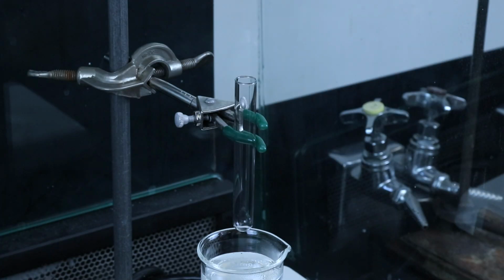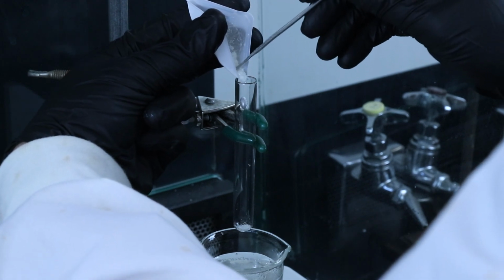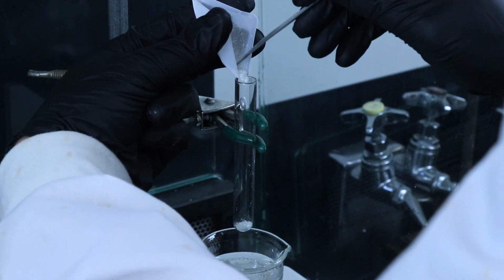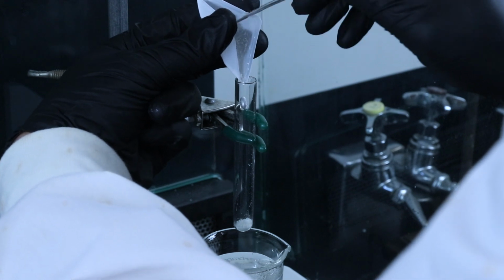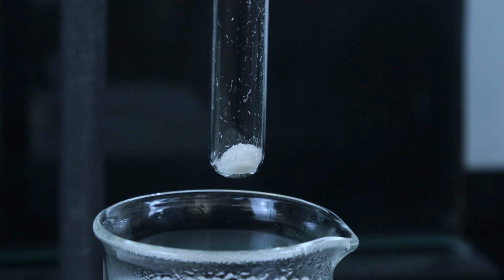So you'll want to transfer your crude product over to either a test tube or a Craig tube, depending on how you plan on separating the crystals from the solution once the recrystallization process is done. And you'll want to use one of these tubes because they are made to withstand more drastic temperature changes without cracking, whereas if you use a beaker or a conical vial, those could break upon transferring them from the hot water bath over to the ice bath.